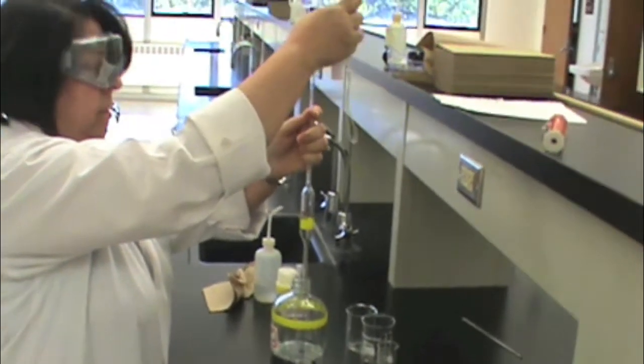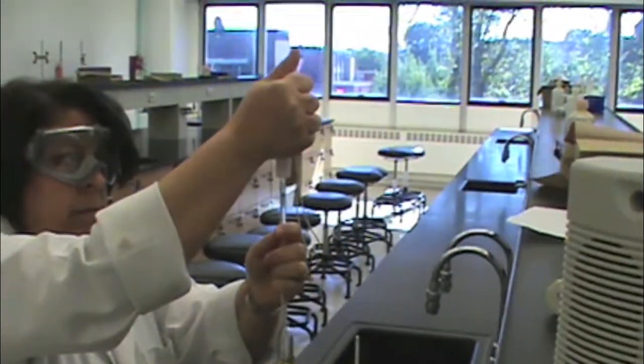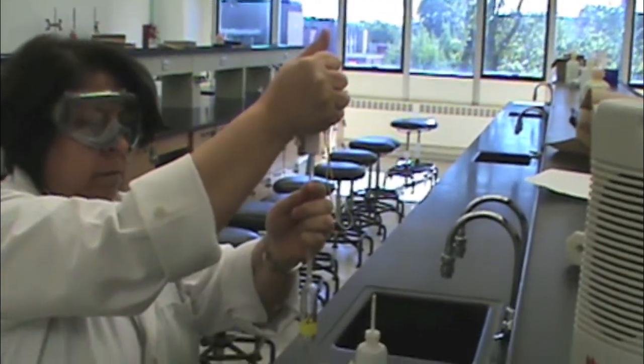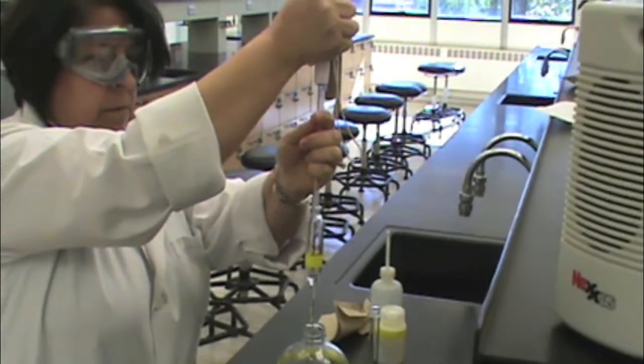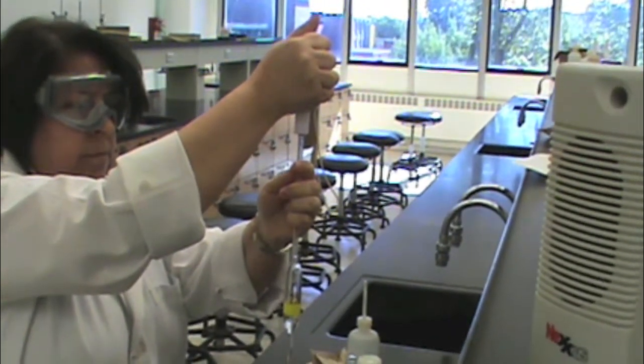Now we will show you how to do the same thing using a pipette bulb. Place your pipette into the solution, squeeze the bulb, and place it over the pipette. Release the bulb to fill the pipette.